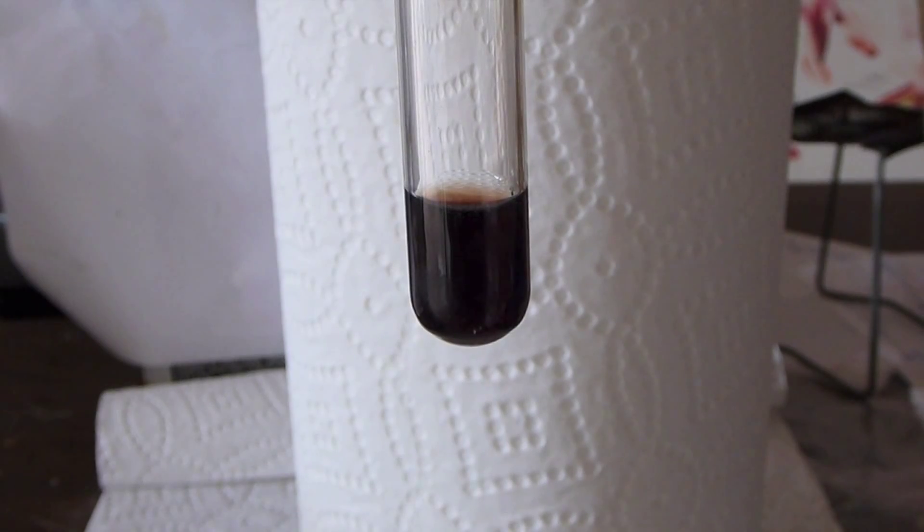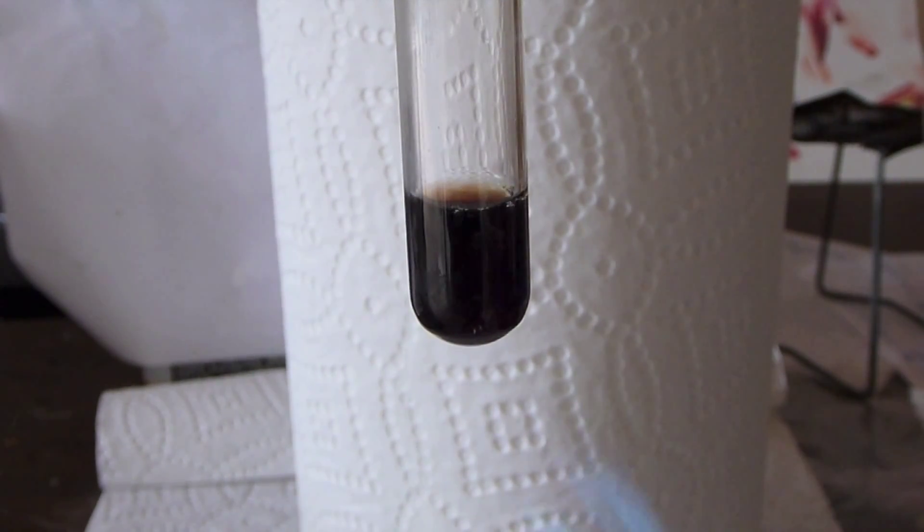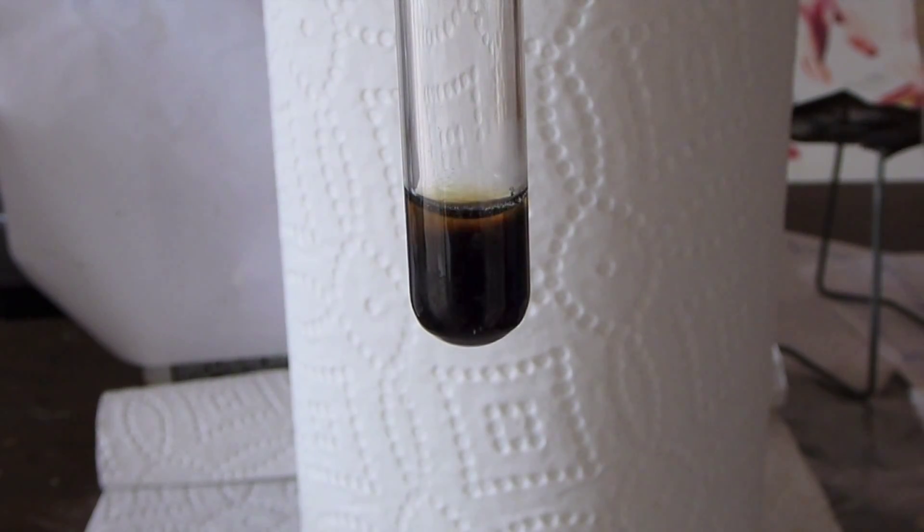So here is this perruthenate solution. Now when I begin to heat it with a propane torch, you see yet another color change happen. It doesn't revert back to the original orange, but the solution does get lighter. But you see the top layer is slowly turning this kind of lighter yellow color, and the rest of the test tube is soon to follow. Well what is happening here?